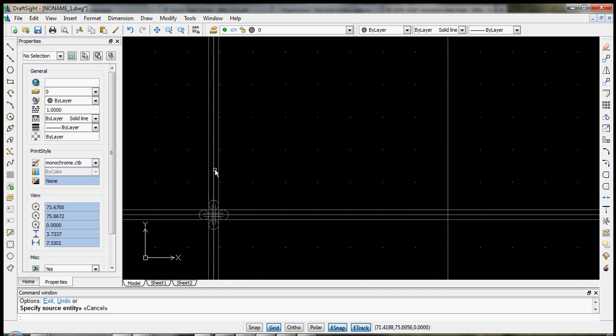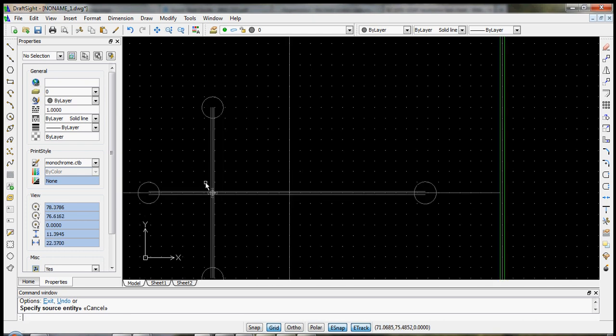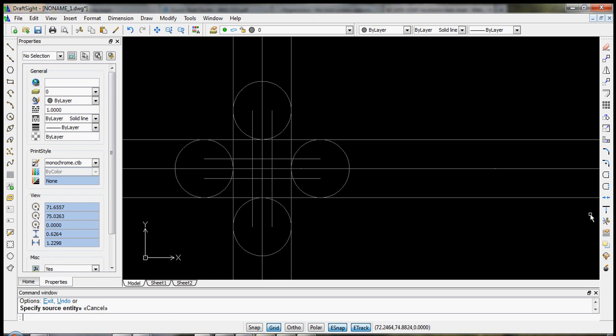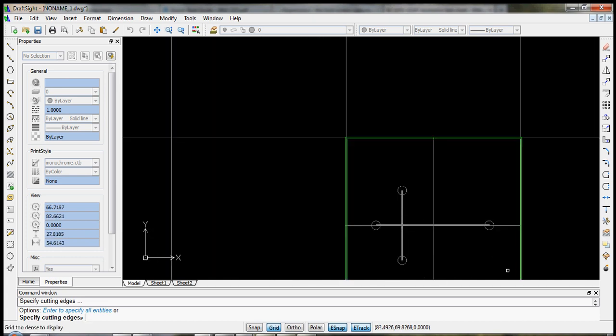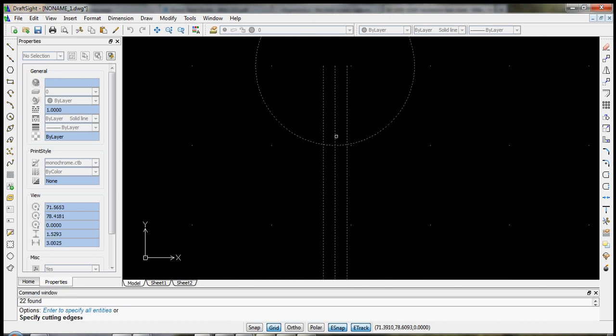Okay, so the first thing that we'd like to do is we need to do something called trim. We could type trim, or it's these scissors down here. The first thing it asks for are what are the cutting edges. In this case, we want basically everything to be a cutting edge. So let's select everything as a cutting edge. And these are simply lines that when they intersect with something else, they can cut. So we're done selecting cutting edges, and now we specify segments to remove. Okay, here we go. Let's start cutting.